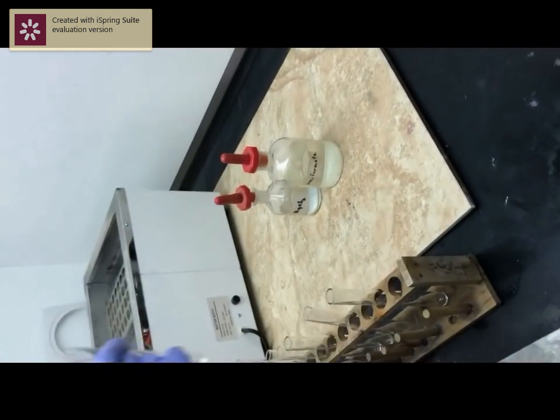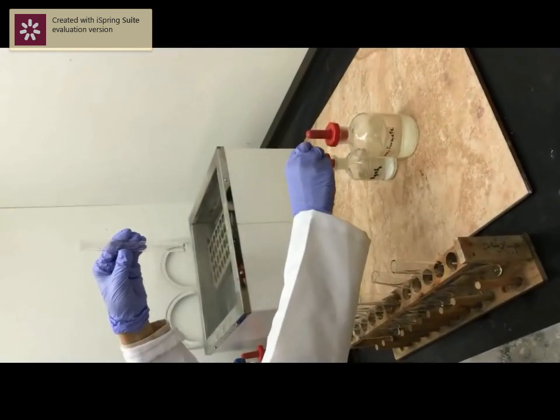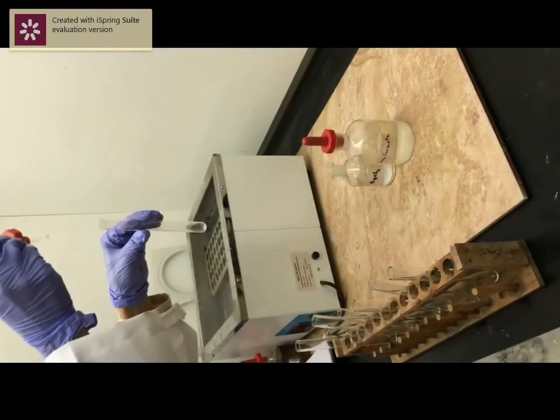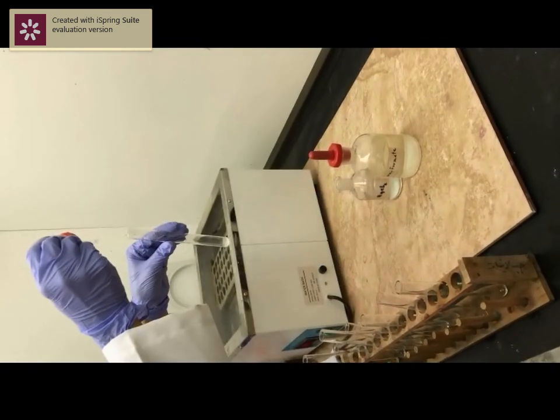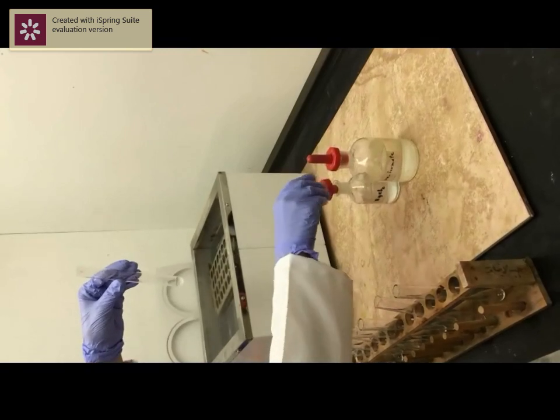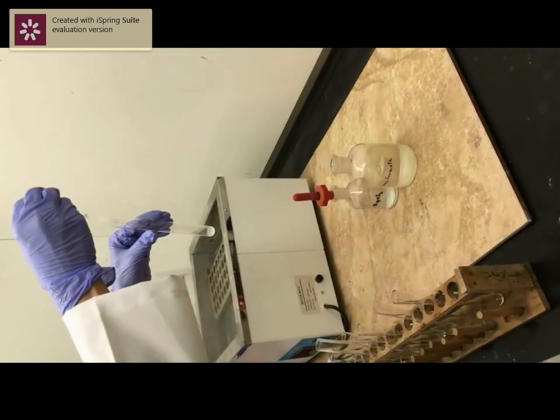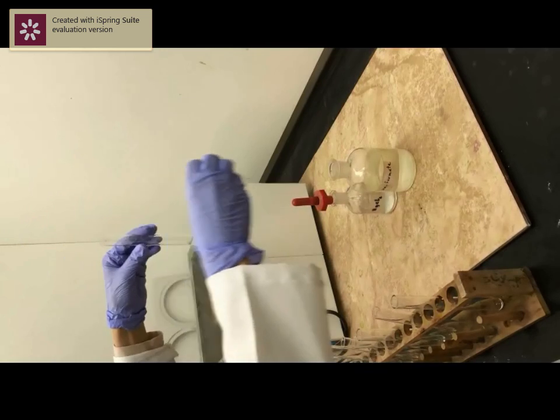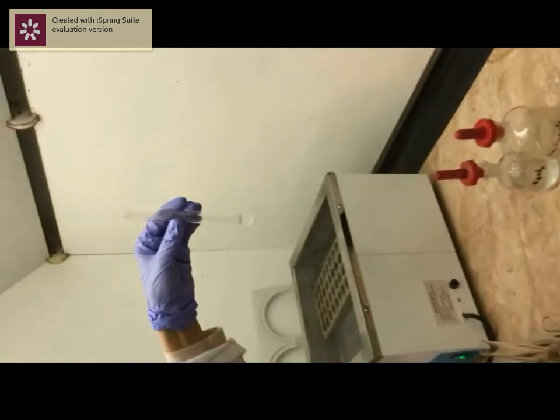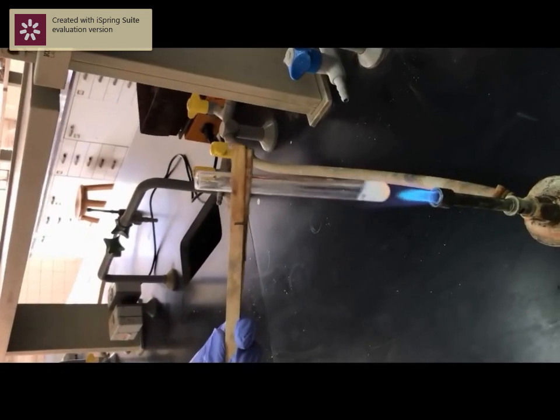Now, start with clean test tubes and add mercury chloride, about 1 ml. Then add sodium formate solution. We will warm the solution. Note the formation of white precipitate.